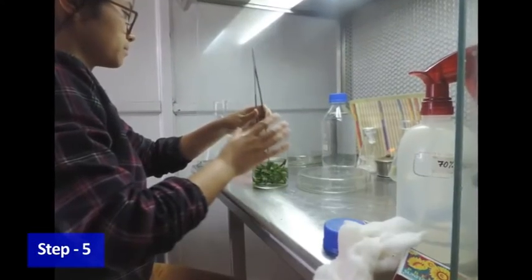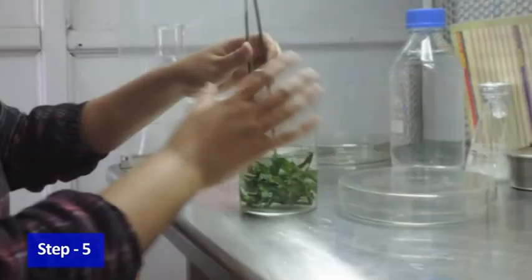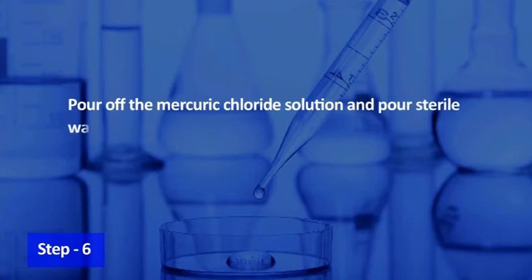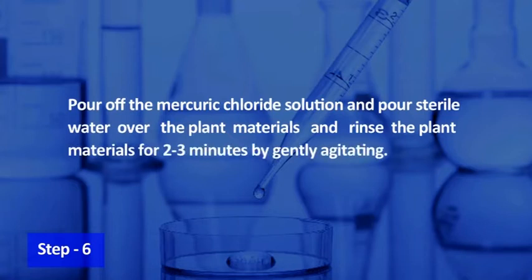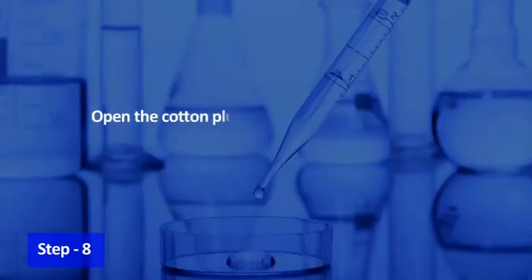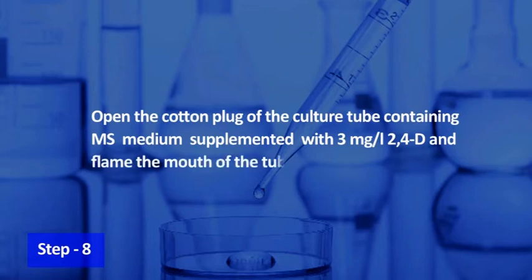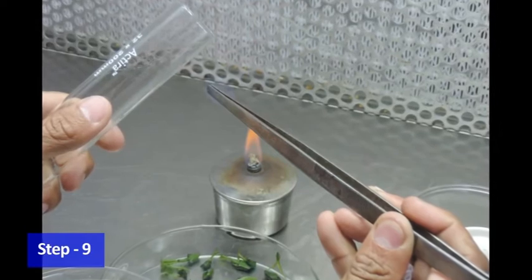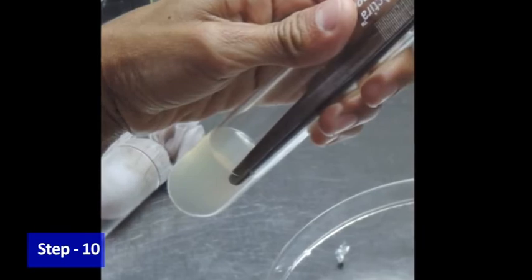Remove the cap of the container containing the plant materials and pour 0.1% mercuric chloride solution and replace the cap. Wash the plant materials by intermittent shaking for 6 minutes. Pour off the mercuric chloride solution and pour sterile water over the plant materials and rinse for 2–3 minutes by gently agitating. Repeat the rinse with sterile water for 3–4 times. Open the cotton plug of the culture tube containing MS medium supplemented with 3 mg per litre 2,4-D and flame the mouth of the tube. Flame the forceps and cool them by touching the medium in the culture tube. Use the forceps to hold the explants and place them on the medium by gently pressing so that the explants make contact with the medium.